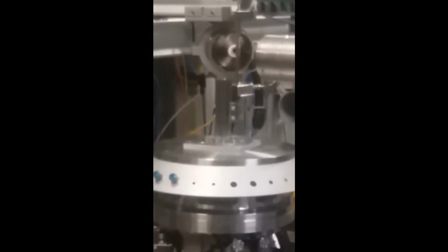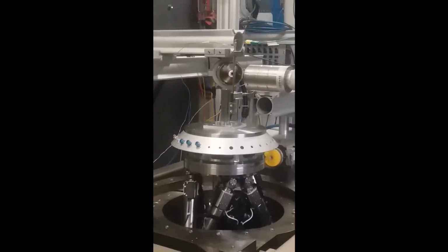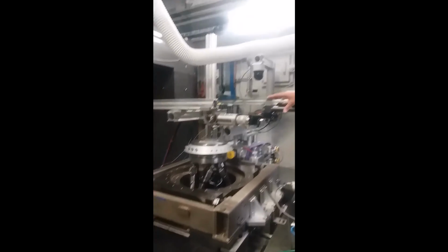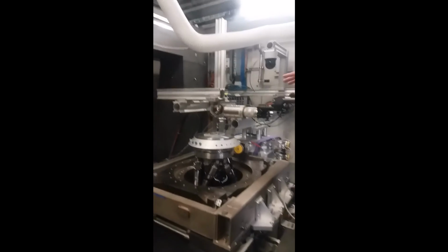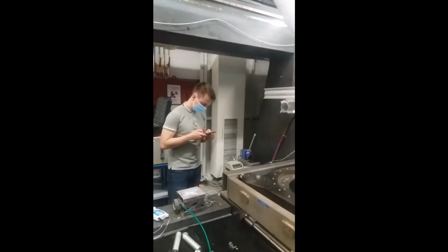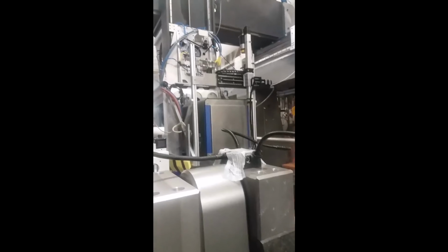They are like your typical fan in your bathroom, right? So we heat it up to about 800 degrees Celsius. And then we're going to move the detector about here, right? And we study what's happening with the material as it undergoes catalysis.